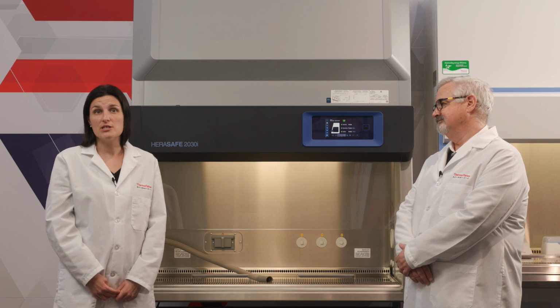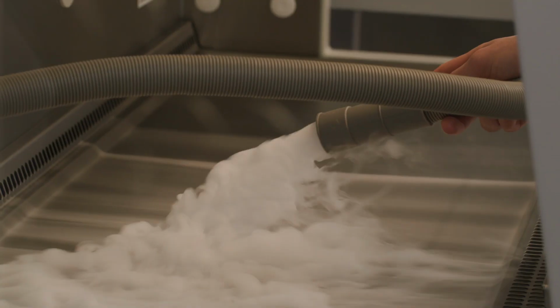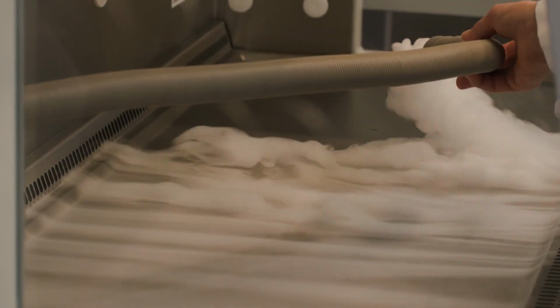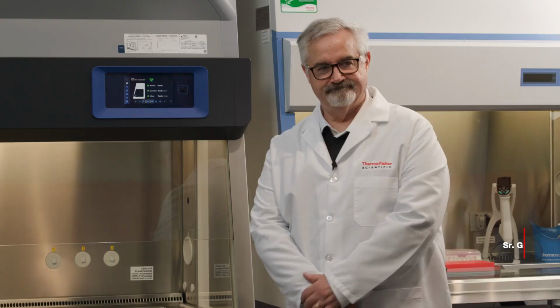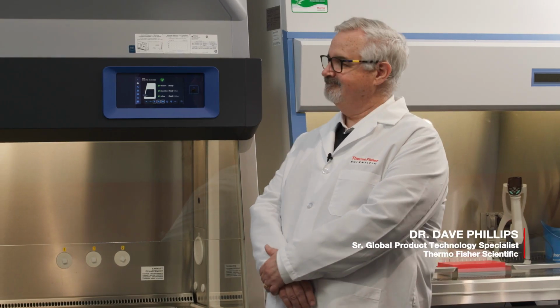And today we're going to talk with you about airflow, how we can see it, why it's important, and how it controls particulate contamination. To discuss this topic, I'm joined by our subject matter expert, Dr. Dave Phillips. Thank you so much for joining us today.